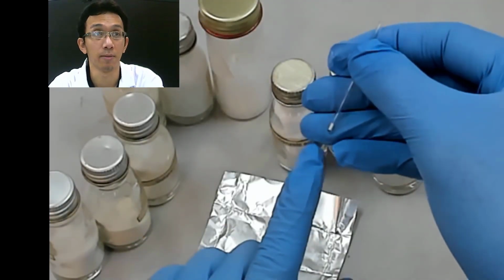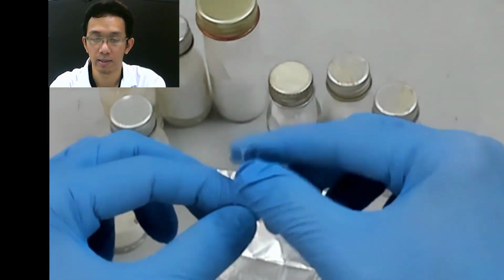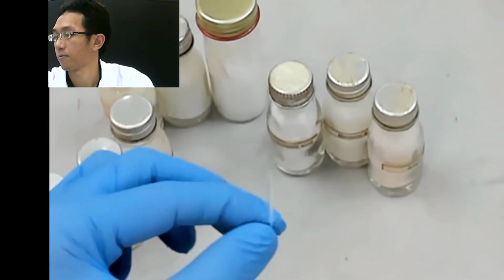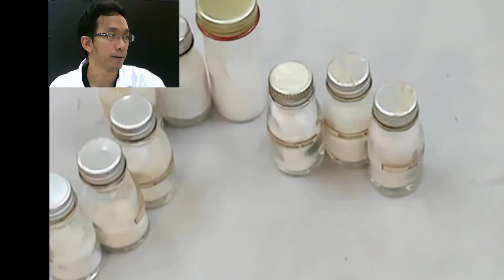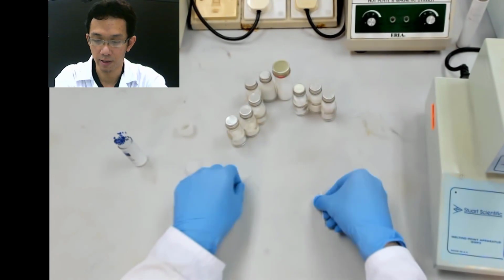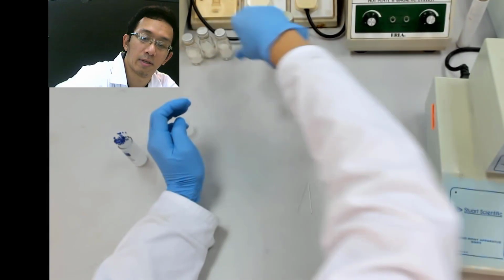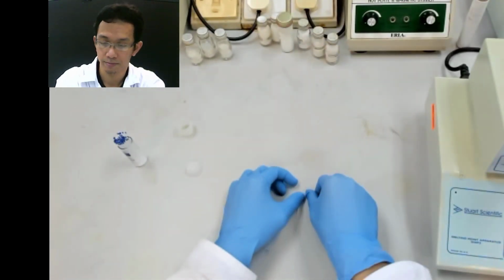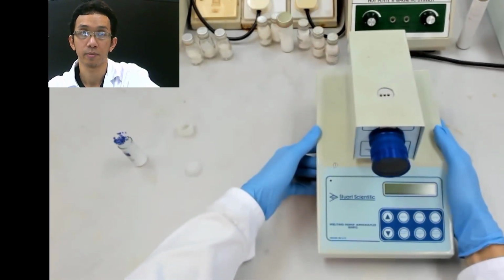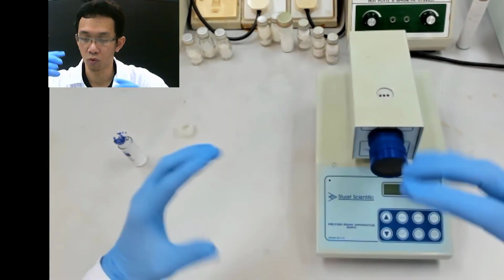So now we want to see what is the melting point of our unknown. So we bring this over there. We don't need this anymore. So this we put over there. And then we bring our machine. So this I put here. I will bring the machine here, and I will zoom it. And I will take this camera to zoom here.